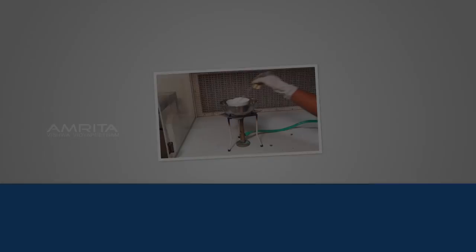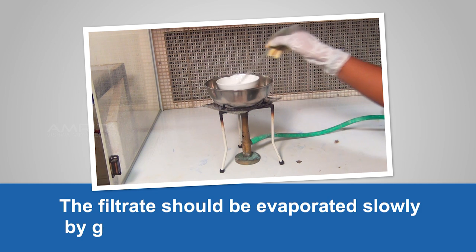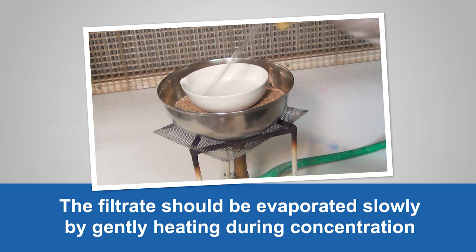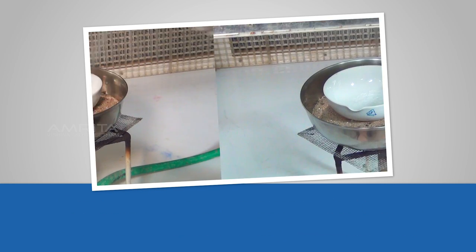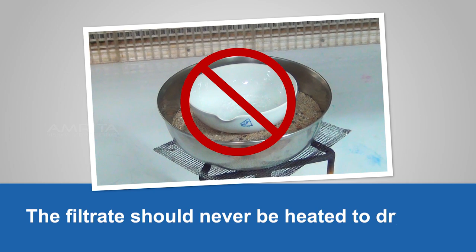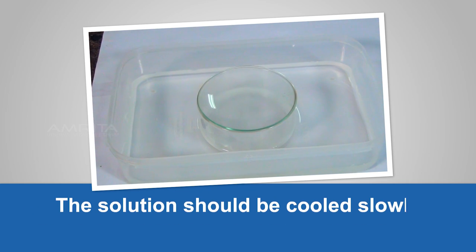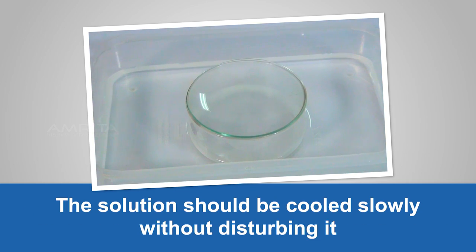Precautions: The filtrate should be evaporated slowly by gently heating during concentration. The filtrate should never be heated to dryness. The solution should be cooled slowly without disturbing it.